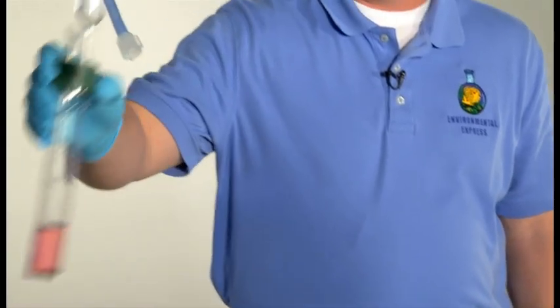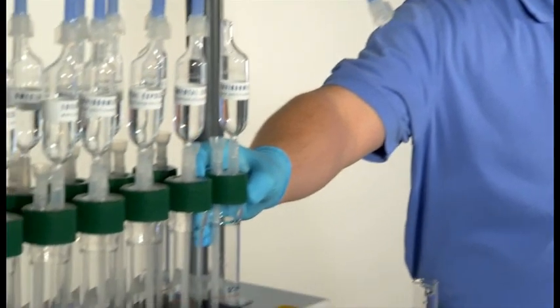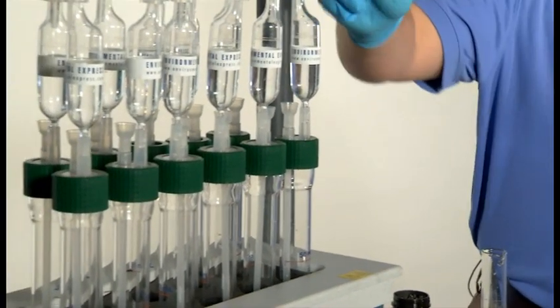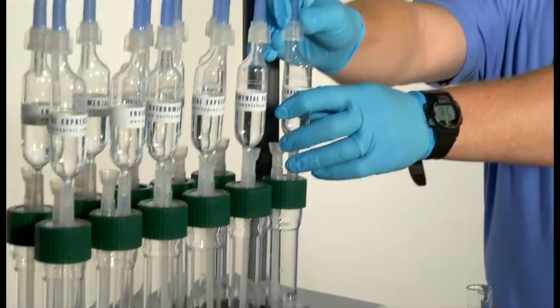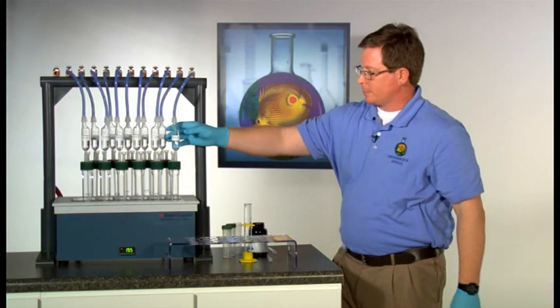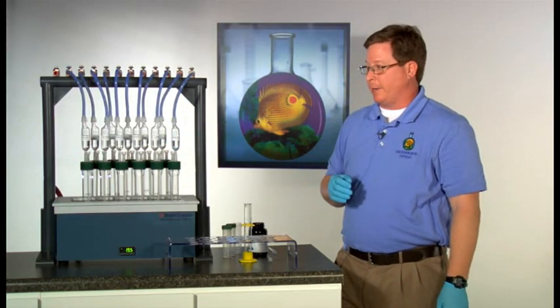The boiling tube is now ready to be placed into the hot block. Attach the vacuum adapter tube to the top of the trap. You're now ready to turn on your vacuum.